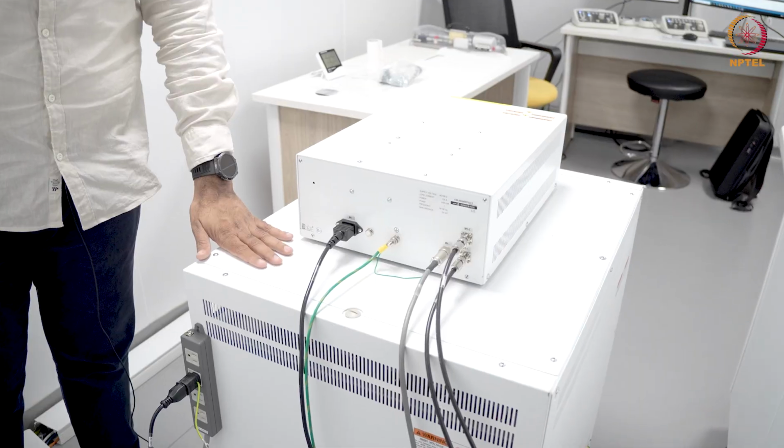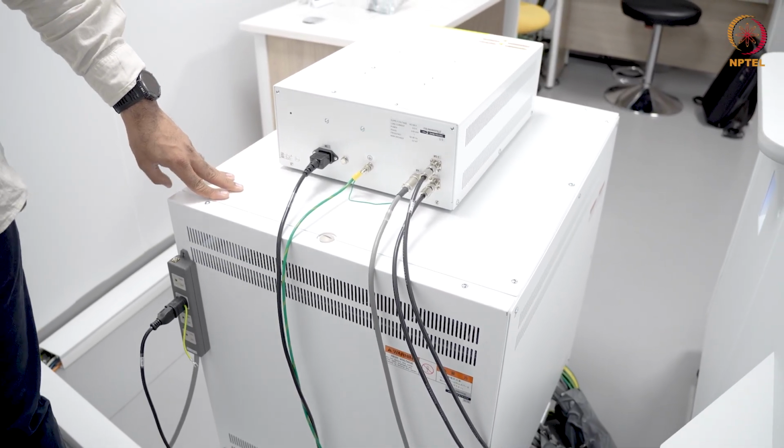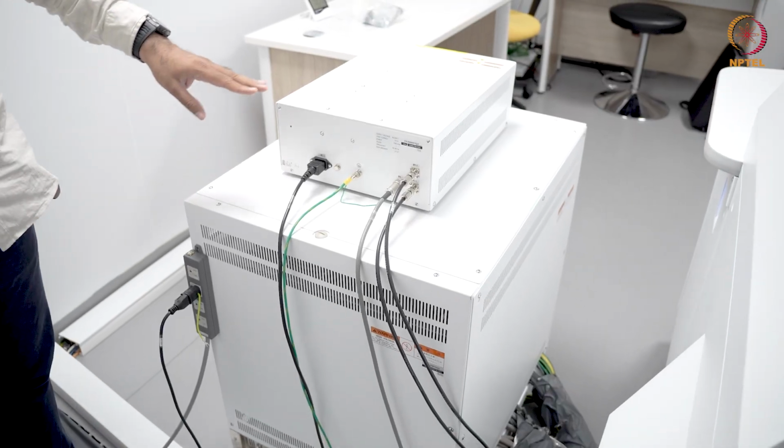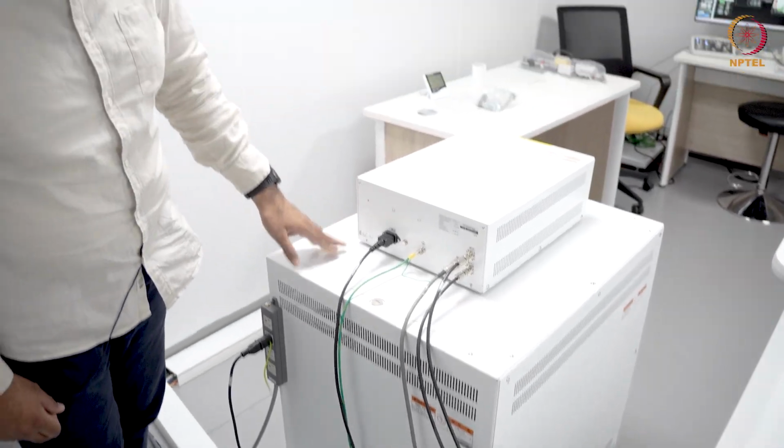So usually there are several electronic cards which are controlling either your corrector or the instrument, various scan coils and so on. And this is not something that we frequently look at, but sometimes we turn it off and on again when there are some errors in the system.